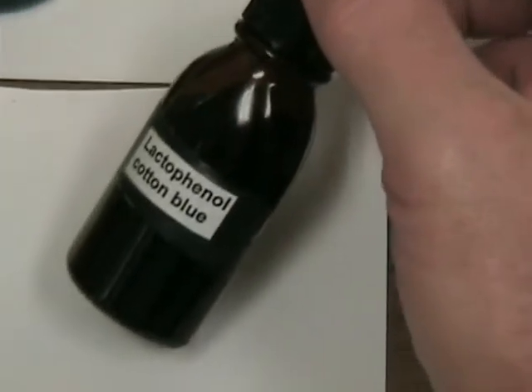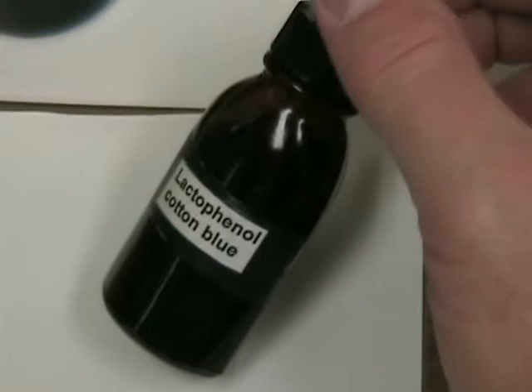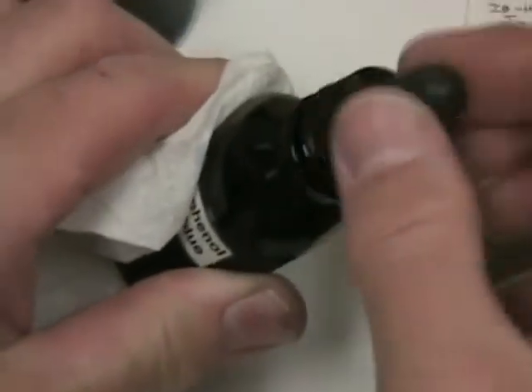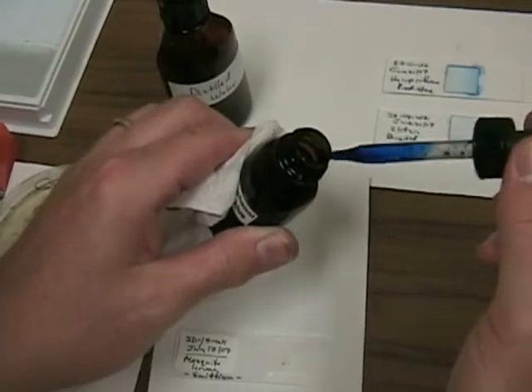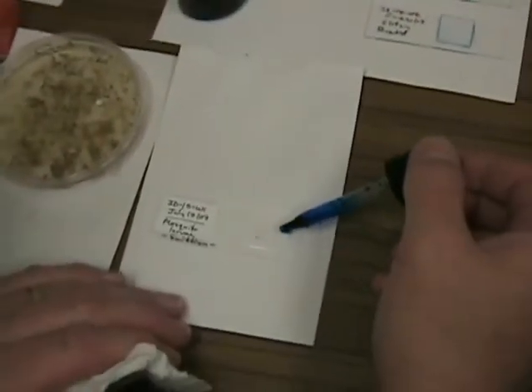What we use here is a very traditional mycological stain and fixative called lacto-phenol cotton blue. With this stain, you add a very small drop to the edge of the cover slip.